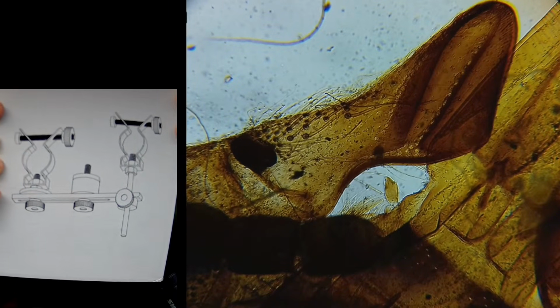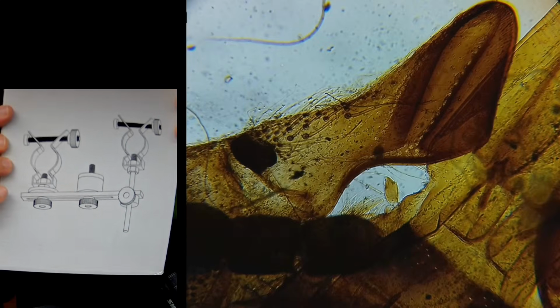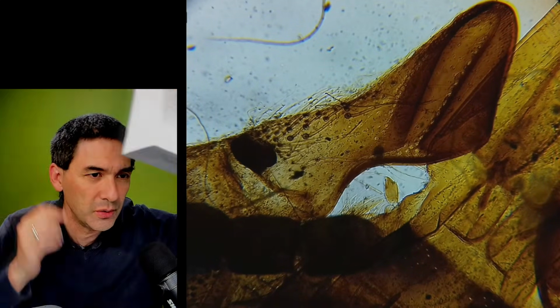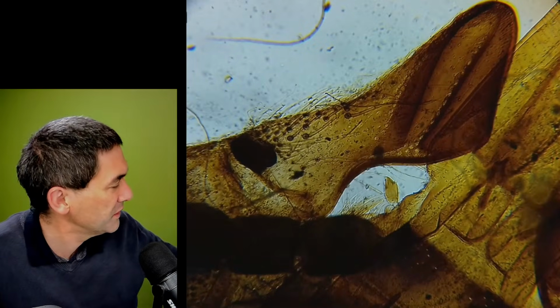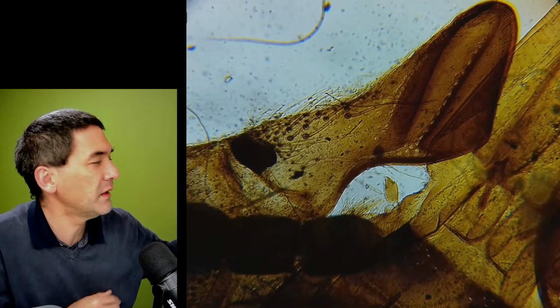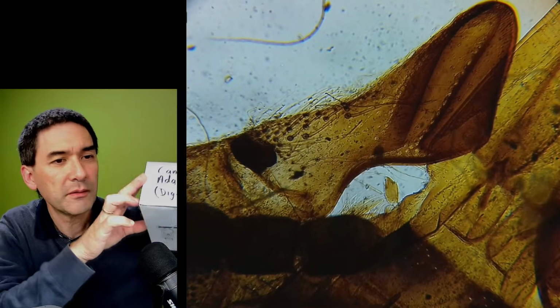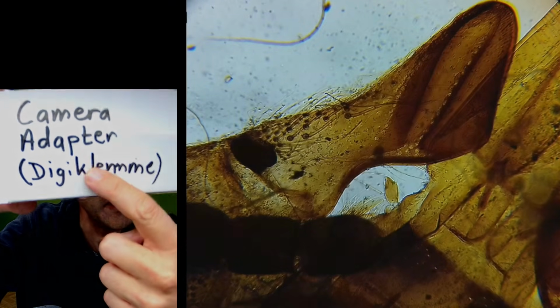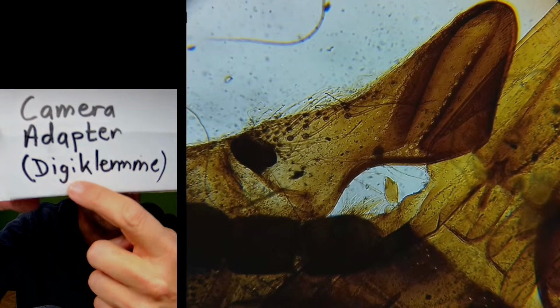Maybe you can get a screenshot, or something. The video is recorded, right? So if you want to see it, it's over here. That's the name. Digi-Klemme. Klemme in German means clamp, so it's a digital clamp.